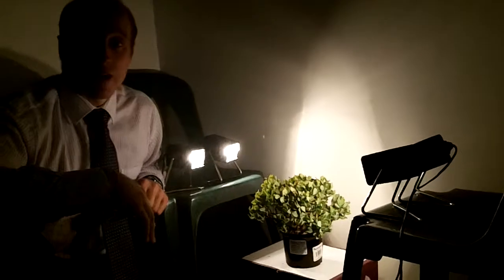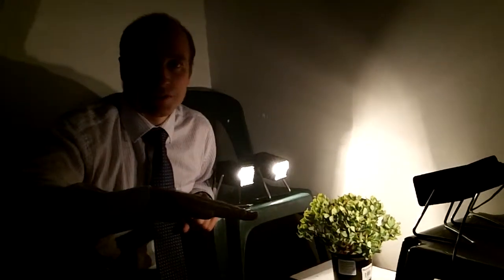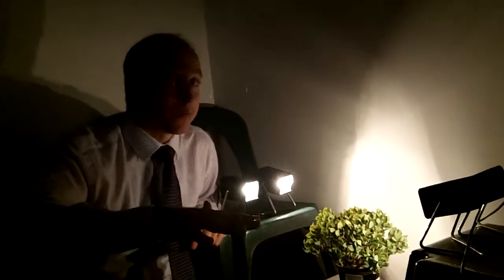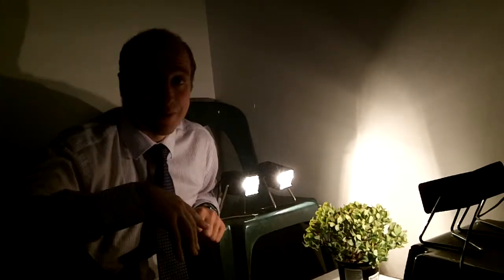I'm going to run this experiment over two full days — I'm going to spend a long weekend in the lab, well it's not really a lab, it's a dark room at school. It's well ventilated, so it has a continual supply of carbon dioxide.